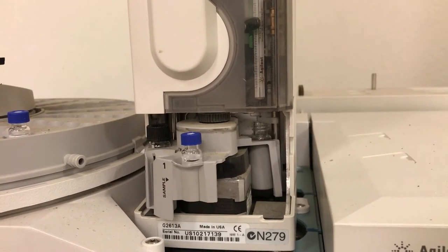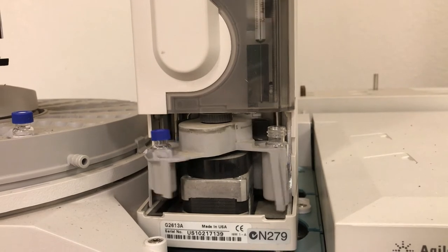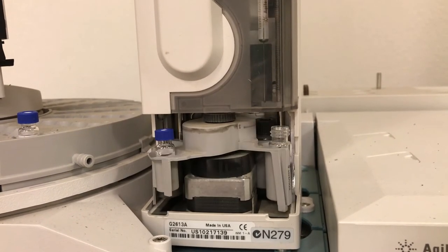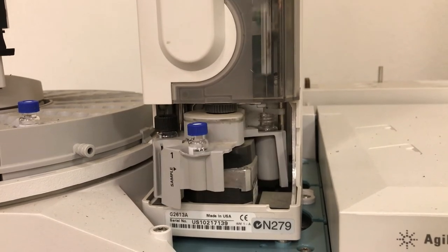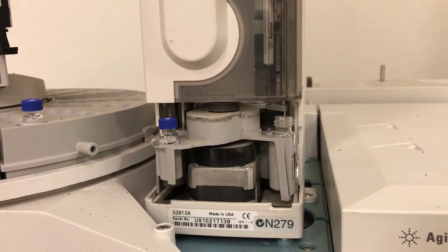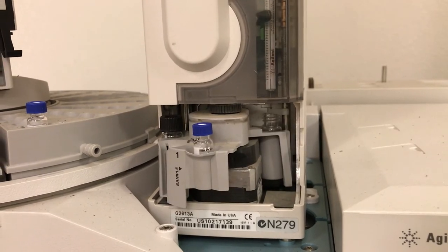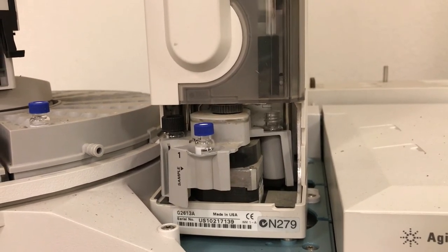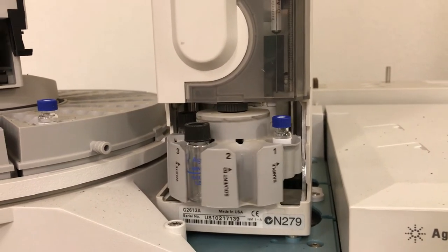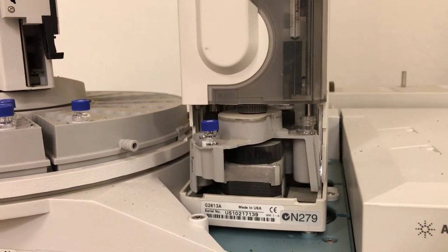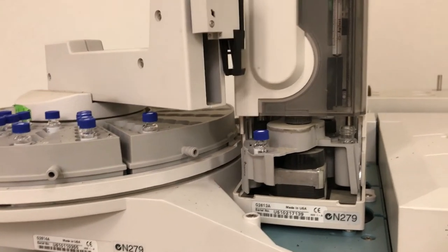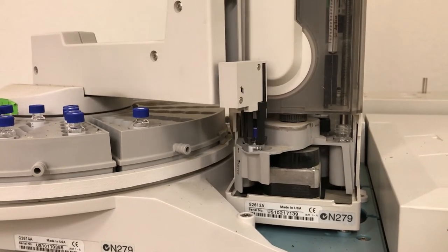So now your small amount of sample is in the GC column, it's in the instrument and it's starting to get pushed through that column with the carrier gas which at my college is helium. What next happens is we have some clean solvent and the robot is going to clean that needle a couple times just to get it ready for the next run. And the robot arm comes and gets your sample and returns it back to the turnstile.